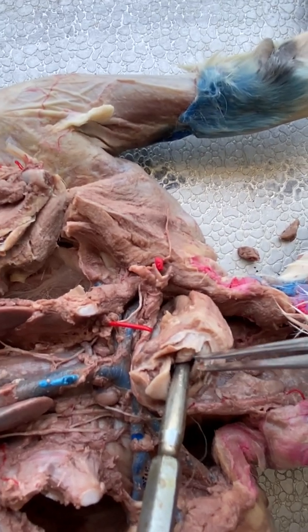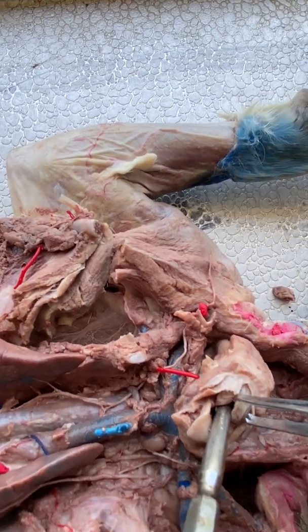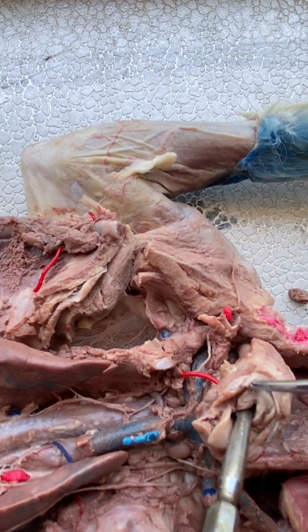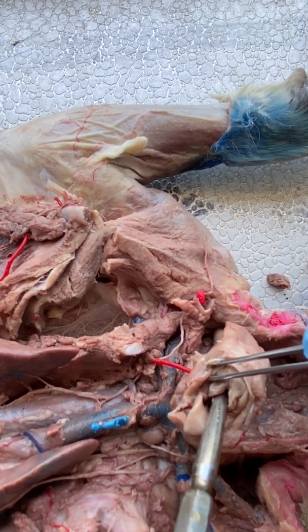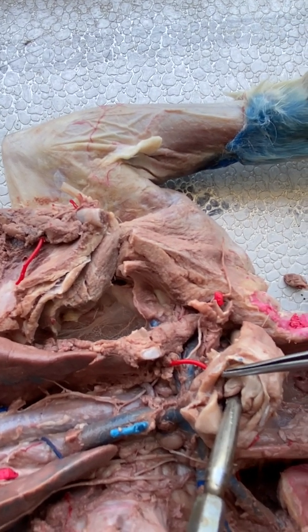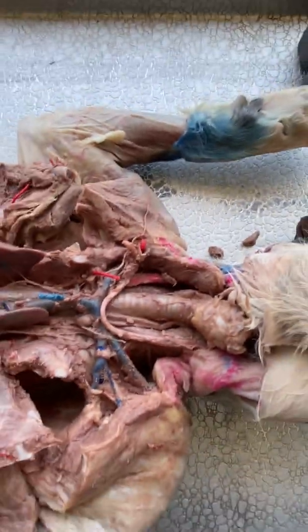What you're seeing right here is our true vocal cords on either side of the glottis. Now if I move this over, we can see there's another flap of skin right here, and it's on the other side as well. So next to our true vocal cords there's another ridge of skin — that's our false vocal cords. So we have the glottis, true vocal cords, false vocal cords, and epiglottis composing our larynx.